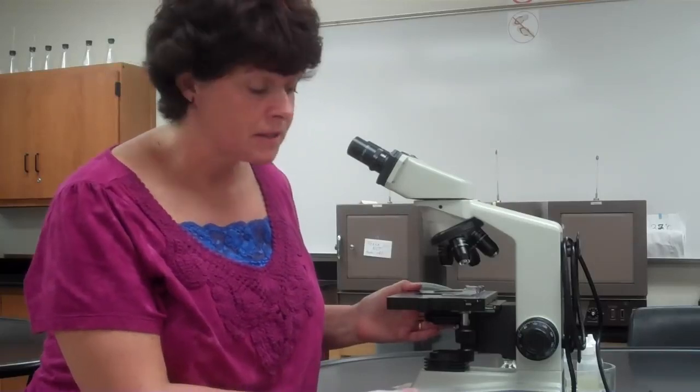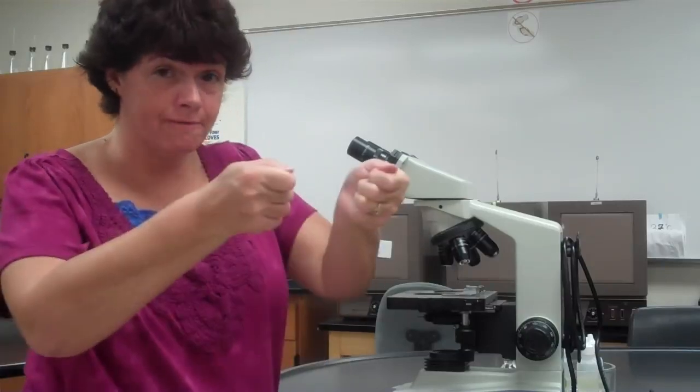You're going to put the cover on it, and remember when you take it back to the microscope cabinet, you carry it with both hands. One hand will be holding the arm, the other hand will be underneath the base. Keep in mind the base gets really hot because of the light. So when you put your hand under there, it's going to be hot, but you still have to hold the microscope, okay? When you put it in the cabinet, the lens side goes in first.